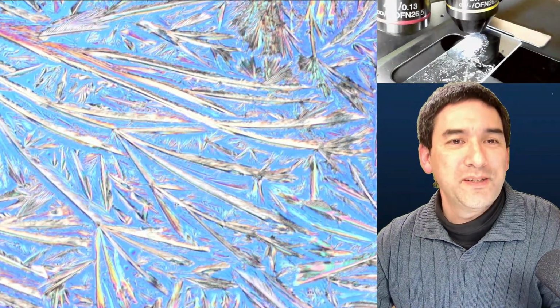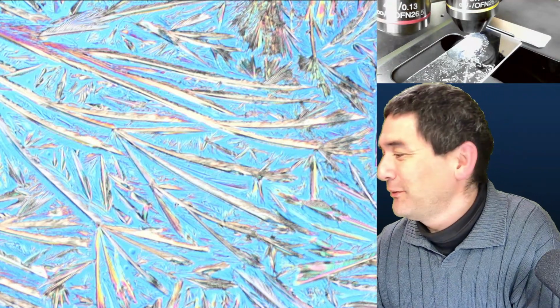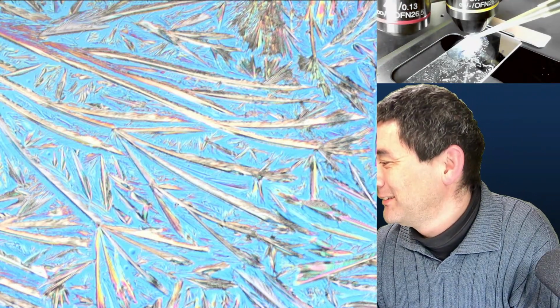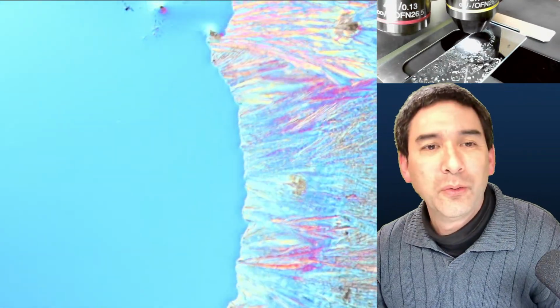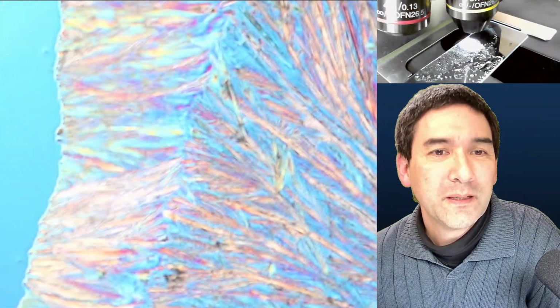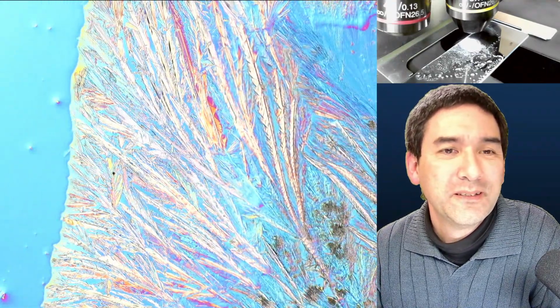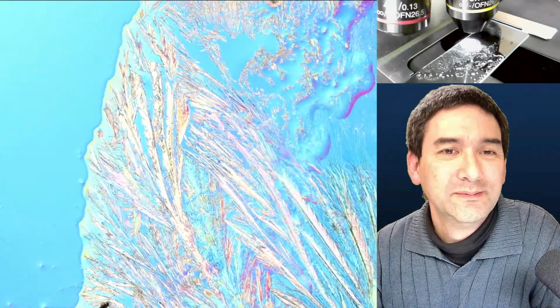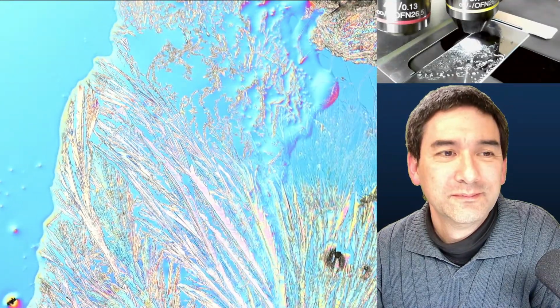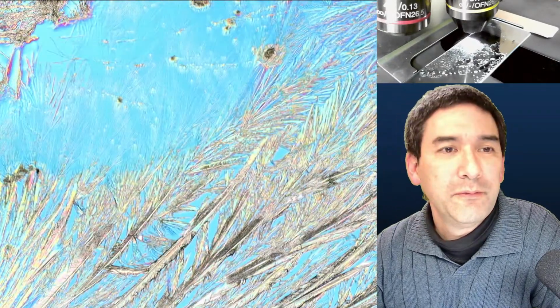Why not try this again just for the fun of it? So add a tiny amount of alcohol again. The alcohol will spread very quickly because of the low surface tension. Get it a little bit into focus. See how it dissolves. It spreads incredibly fast.